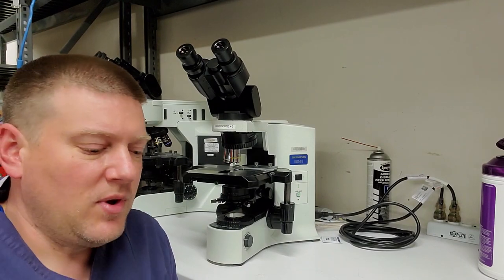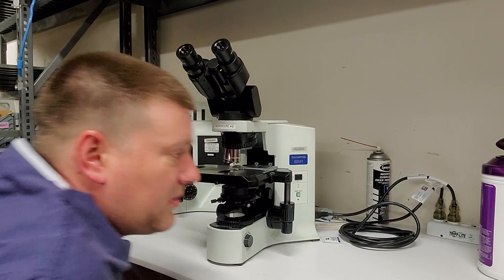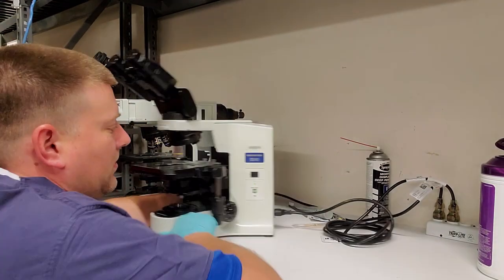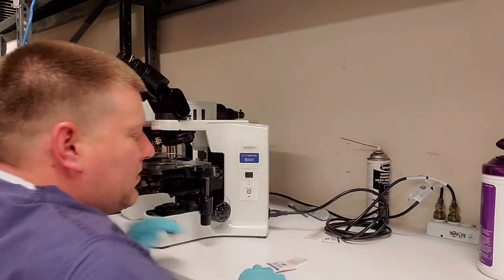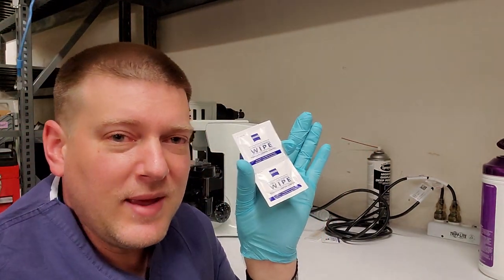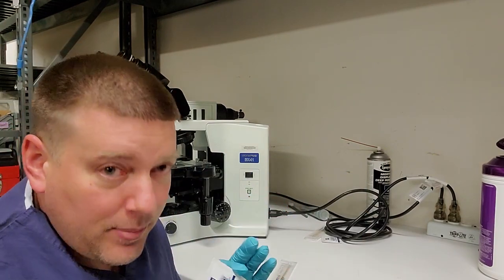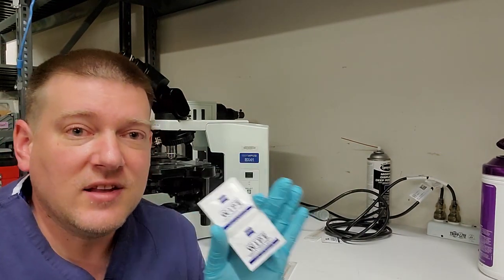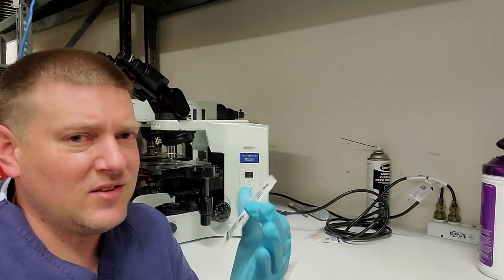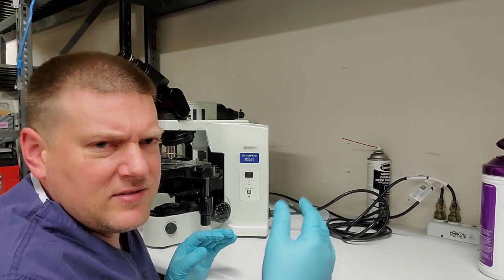Just like when you're working with halogen bulbs, you don't want to touch the bulb because your oils from your hand will contaminate the bulb. Few things that I'm gonna have, I have Zeiss wipes. All right, these are inexpensive. They're brand name Zeiss wipes, which means the material is perfect. It does not leave a residue. You'll see, these things are wonderful. I love Zeiss wipes. They're my absolute favorite. They come in a box of like 50.